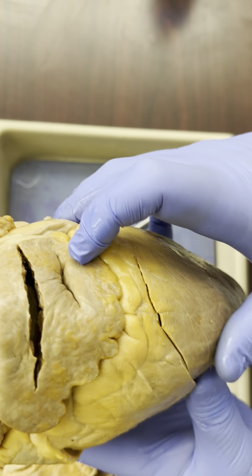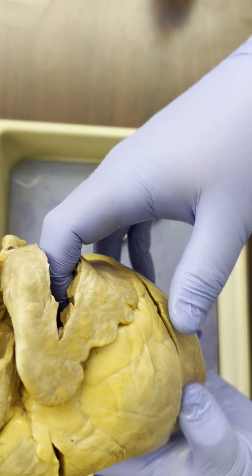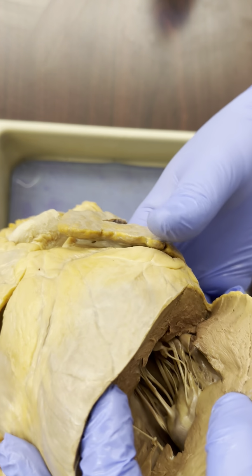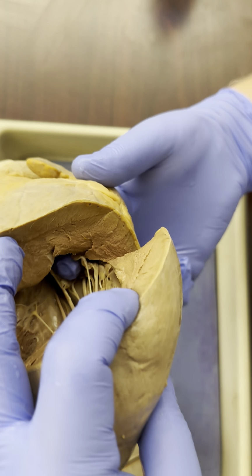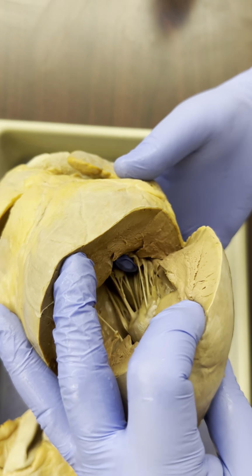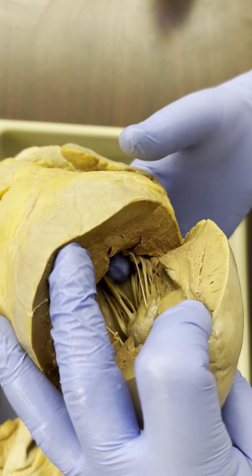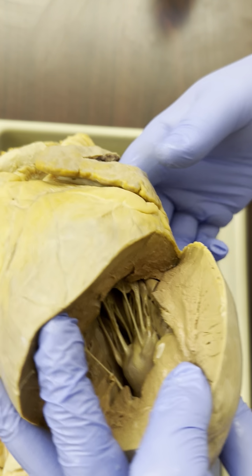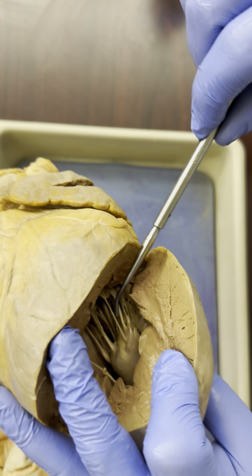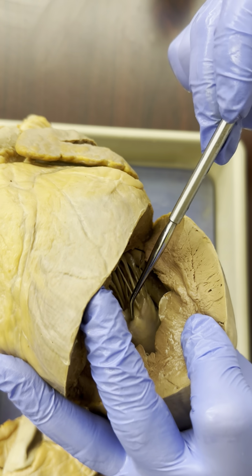Now let's go over to the left side. So here, again, this is the left atrium inside the left auricle. If I push my finger through and then look inside the left ventricle, we could see my finger there, and this membrane around it is the bicuspid valve, the mitral valve, the left AV or atrioventricular valve. And coming off of that, again, more of these strings, the chordae tendineae, and more of that papillary muscle that the chordae tendineae are attached to.